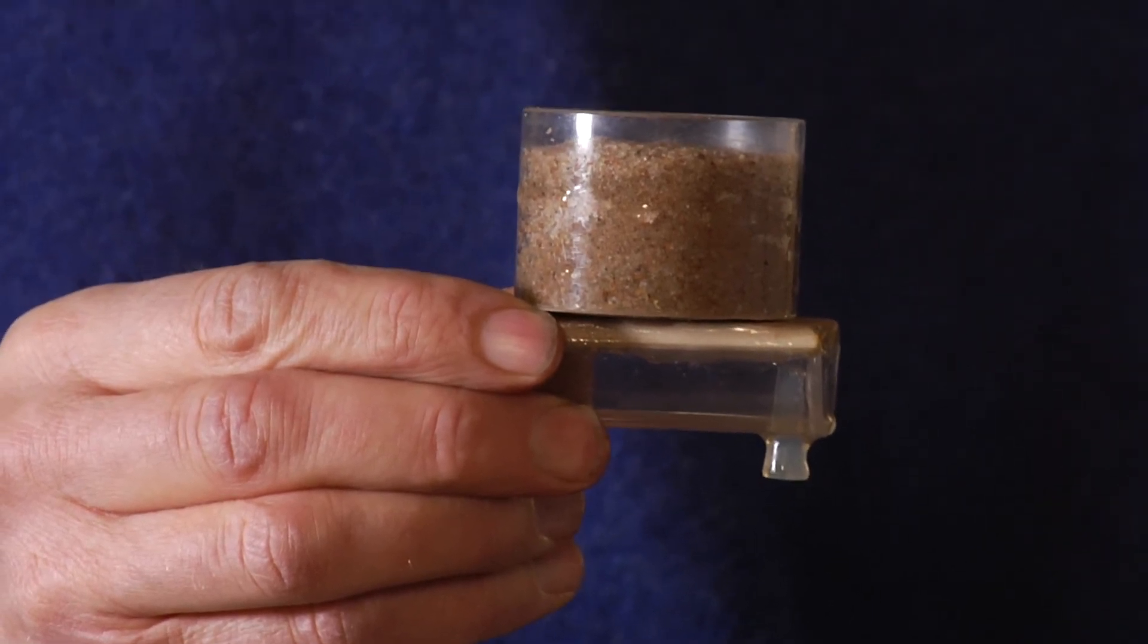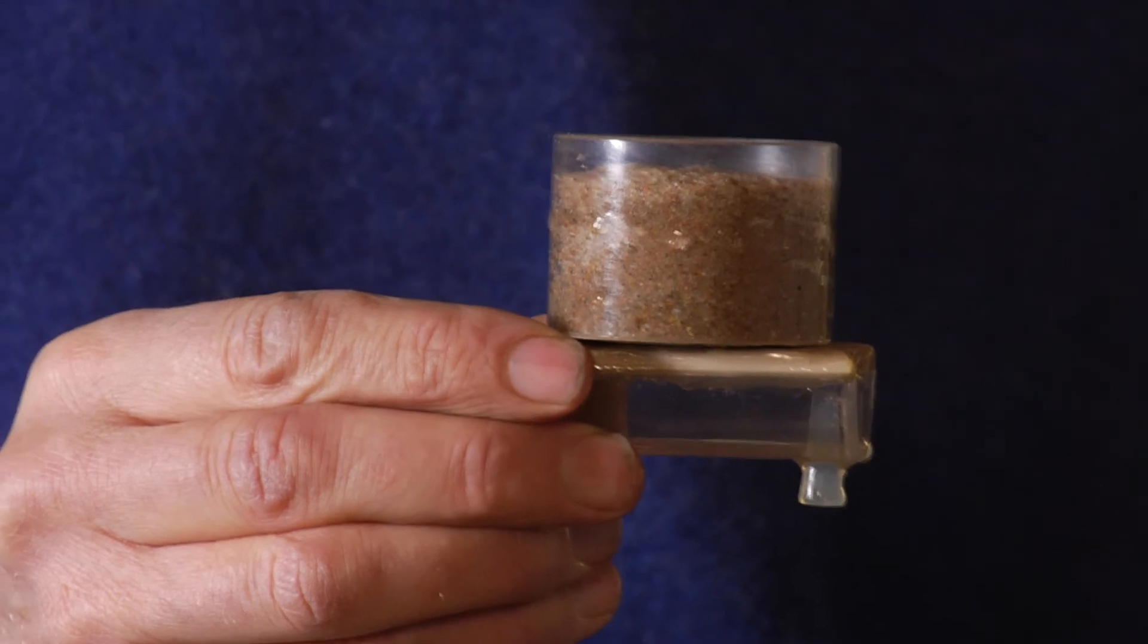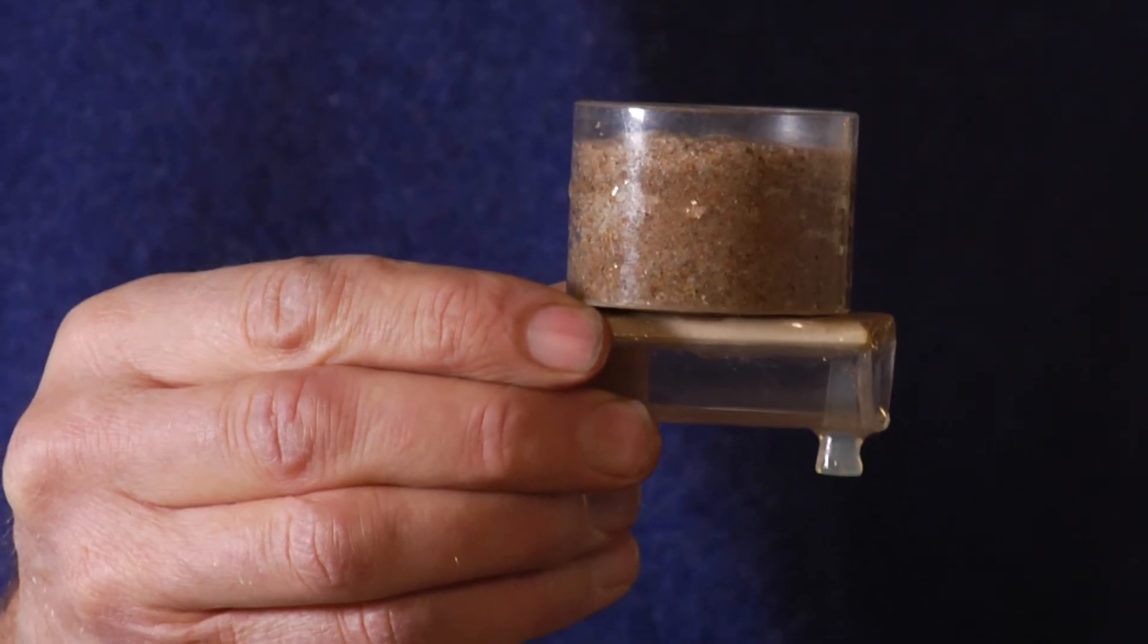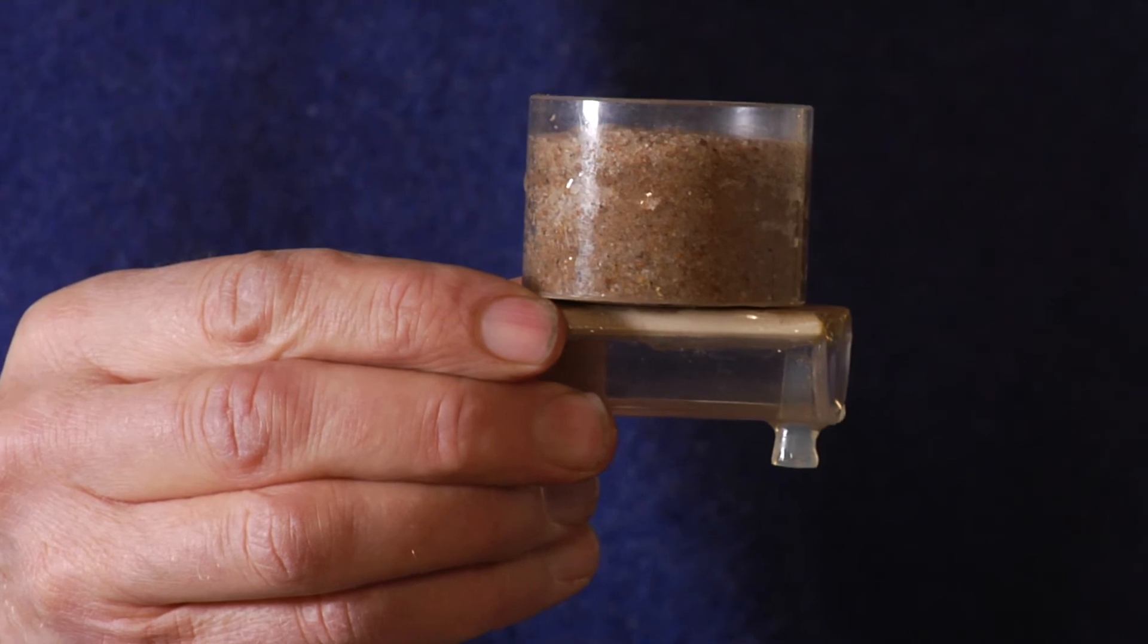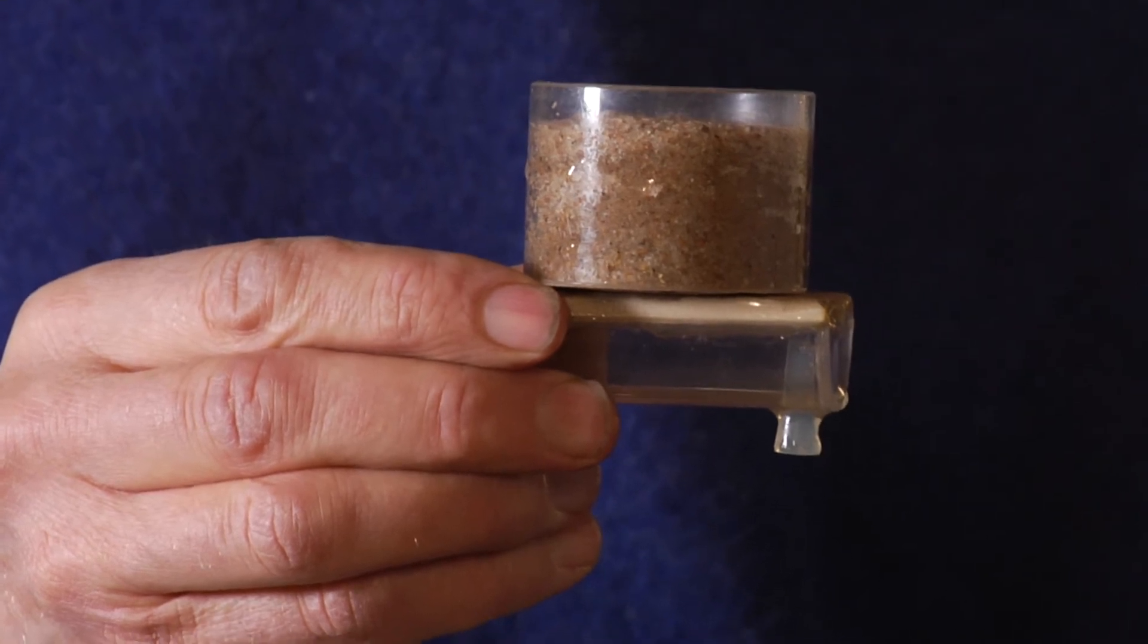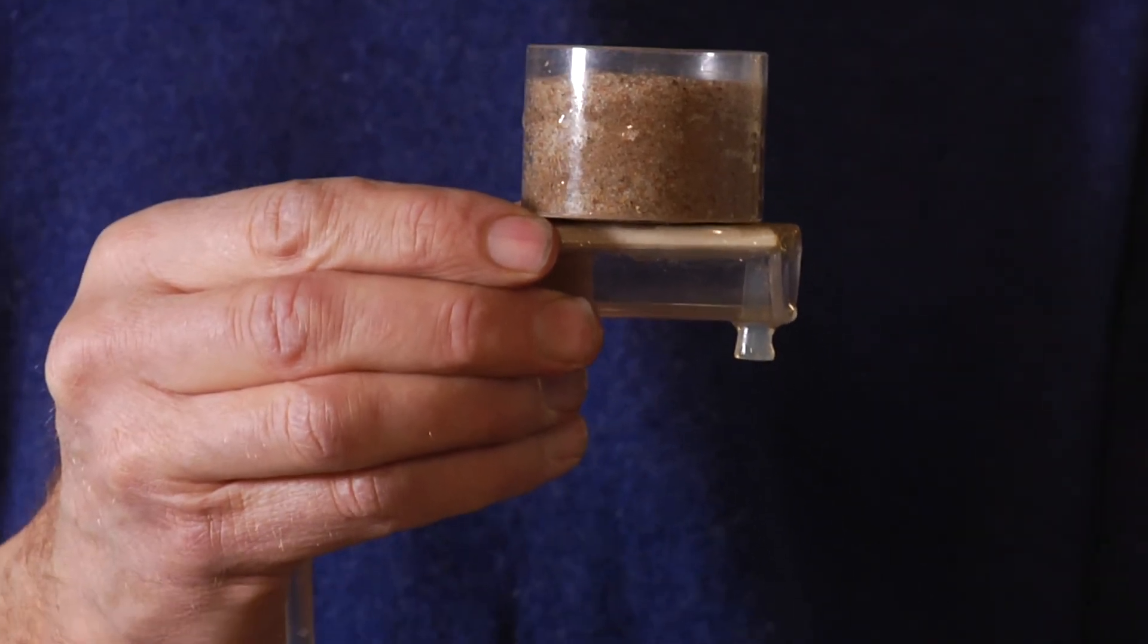Many pores were thus emptied at minus 15 centimeters. I continue the lowering and more pores are emptied, smaller pores, and you can see how the sample gets drier and drier.